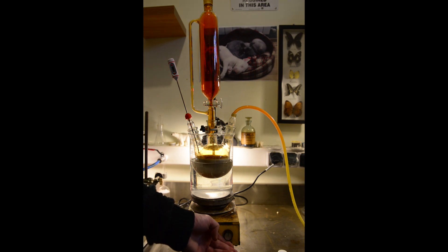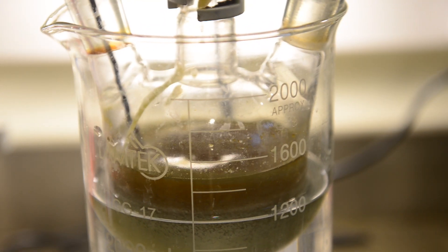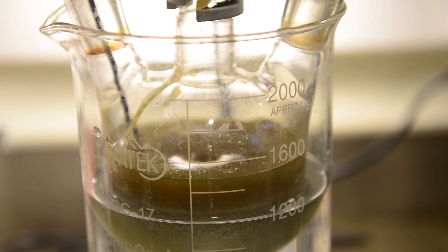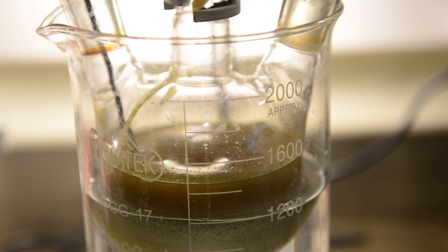At the end of the addition for a few seconds temperature reaches 22 degrees. Mixture starts to boil and emit hydrobromic acid vapors. Clear sign of complex decomposition. But I have managed to cool the flask down below 20 degrees again. For the next time I will prepare more ice before adding bromine. After bromine addition liquid has turned transparent pinkish in color.